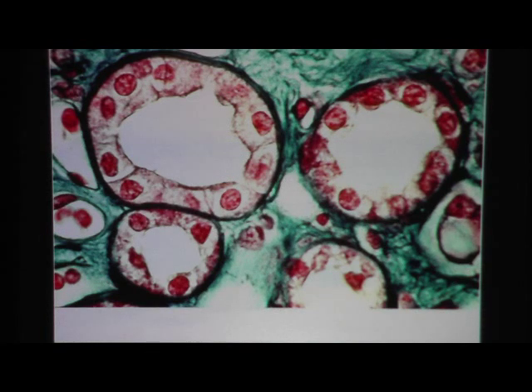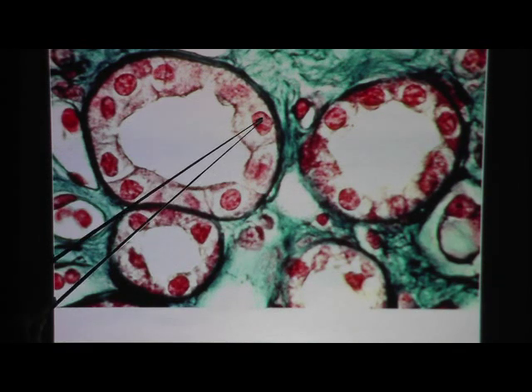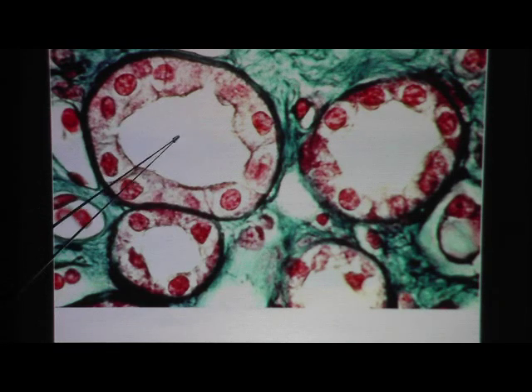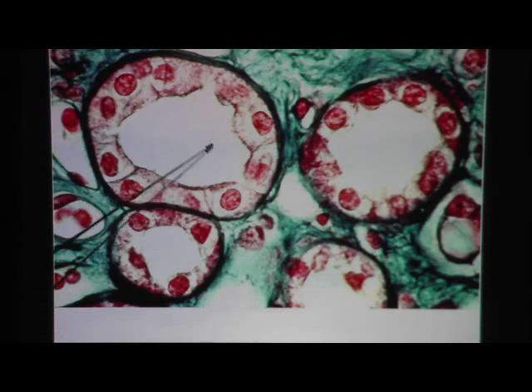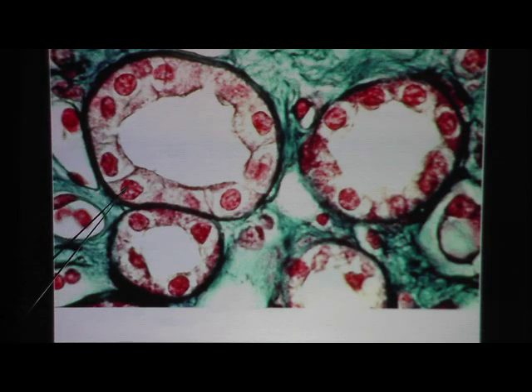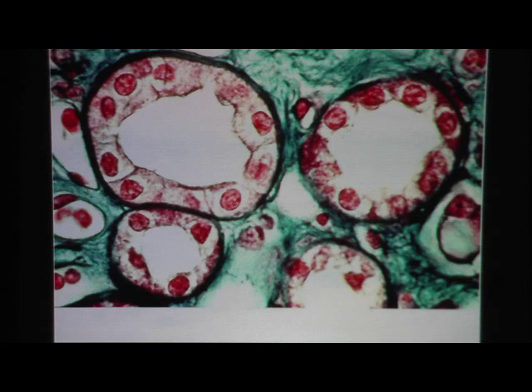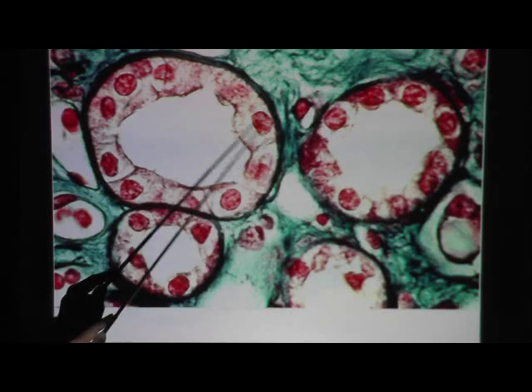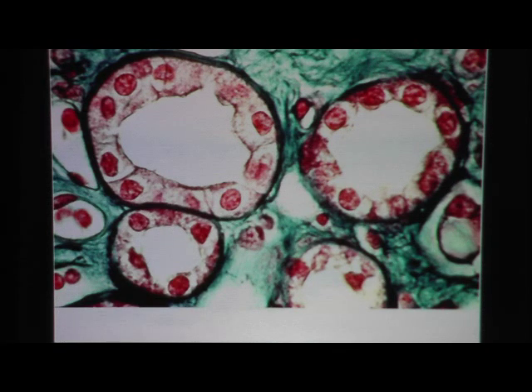Here's another look at simple cuboidal epithelium. Once you recognize it's a round structure with a free surface and potential space, you see it's lining a tube that is only one cell thick. The nuclei are predominantly round, not squished. The height is about the same as the width, so these are cuboidal cells. One layer thick: this is simple cuboidal epithelium.